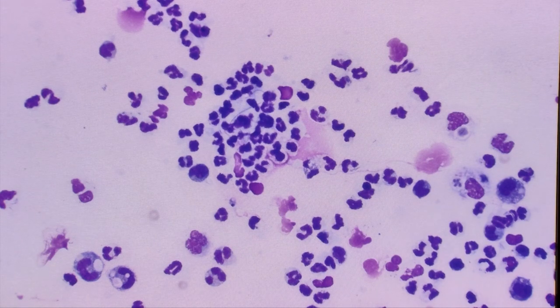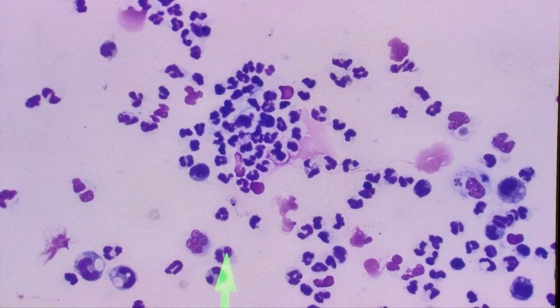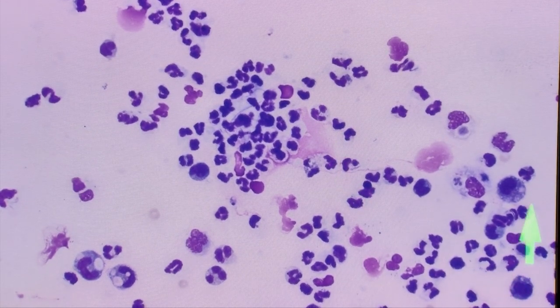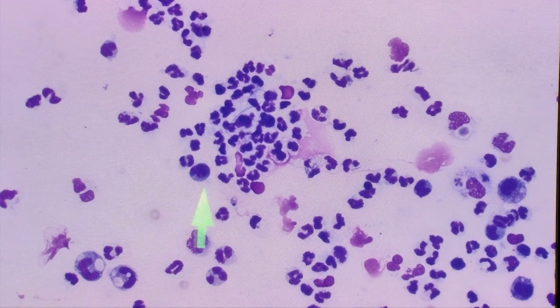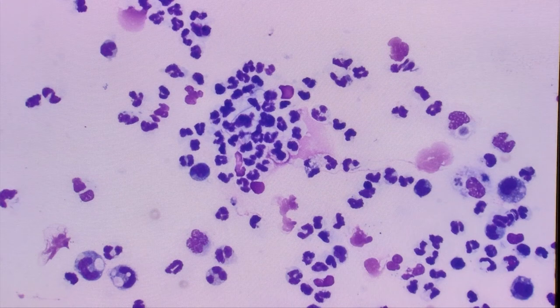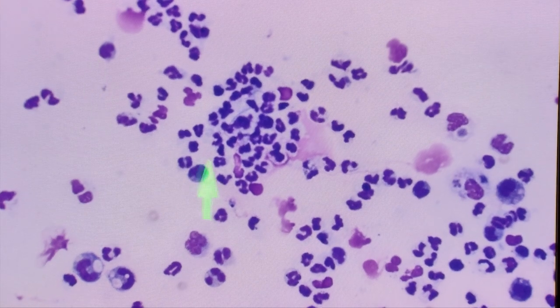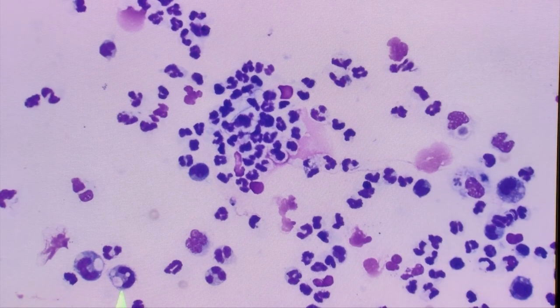At this power we can definitely confirm that yes, we do have neutrophils — all of these with the segmented nuclei are clearly neutrophils. And then there are some larger cells, like this one here and here, that we would call macrophages. There are another couple of good examples down here — there's a nice macrophage there and there.